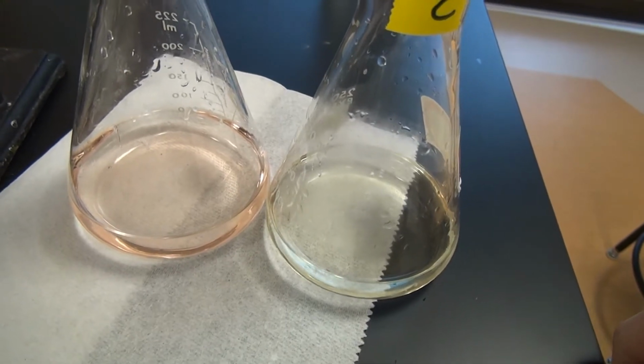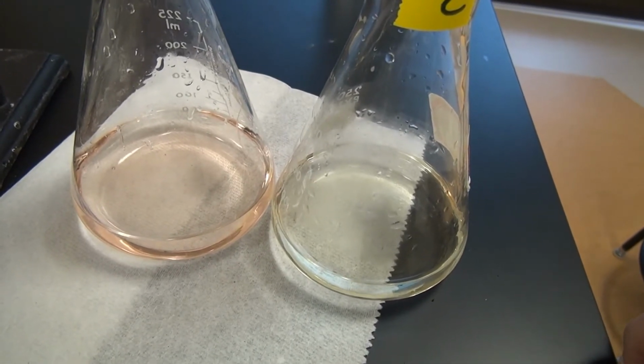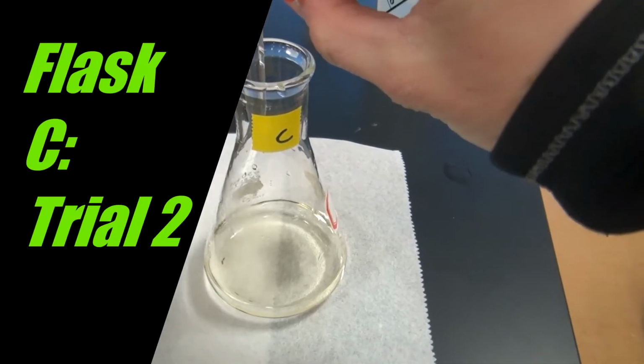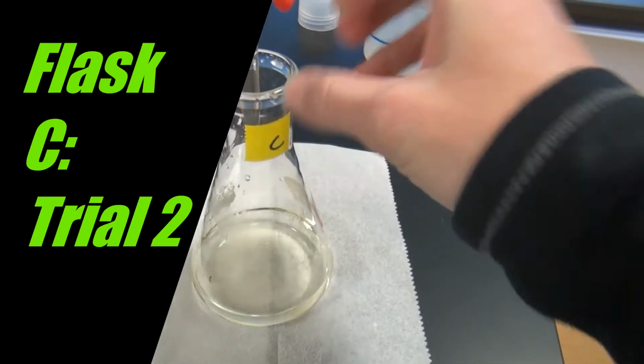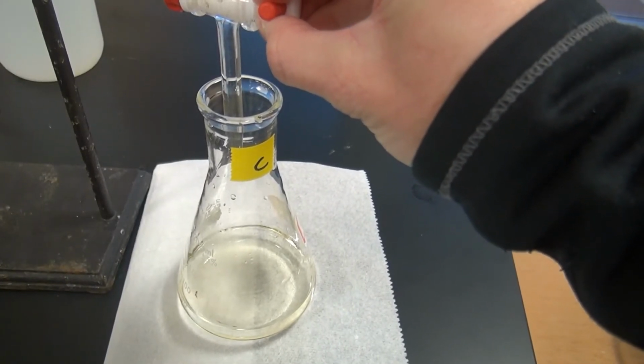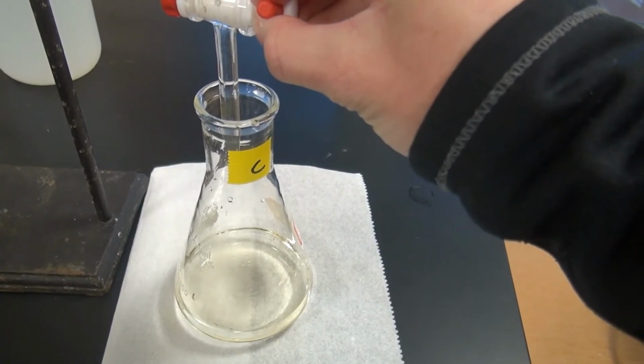Okay, so the previous volume you recorded is what will be your equivalence point. Flask C, we're starting at 0.00. And I'm going to put this on a nice slow steady drip.